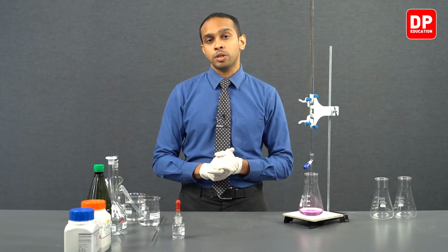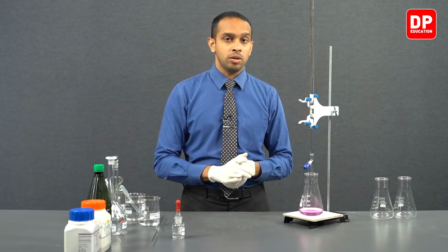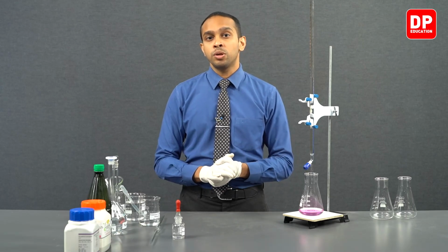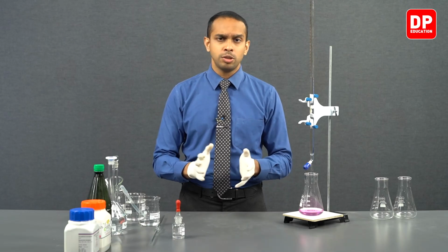I want you to keep in mind, students, when it comes to doing titrations, we normally repeat the same titration 3 times to obtain concordant results, to make sure that the titration readings that we have received are as close as possible to the accurate value. So after obtaining the first titration reading, we'll be moving on to the second and the third titrations. So let's move on to the second titration.